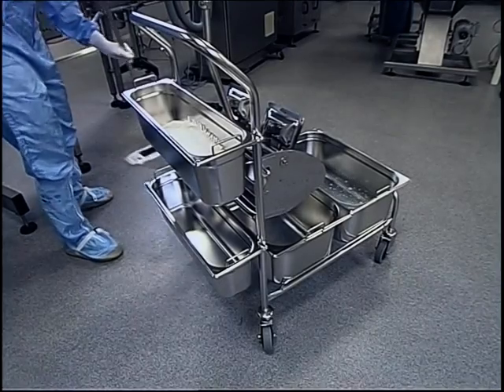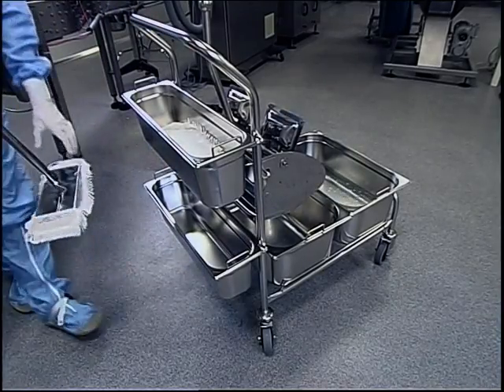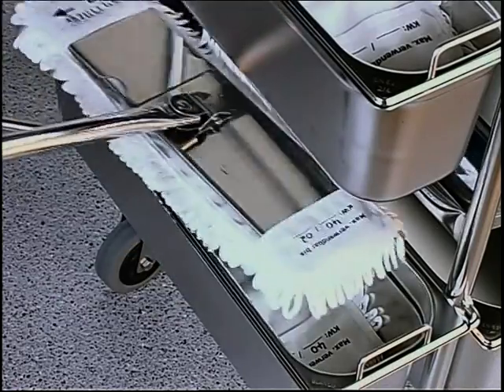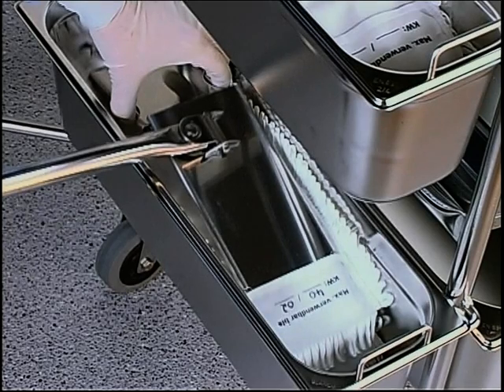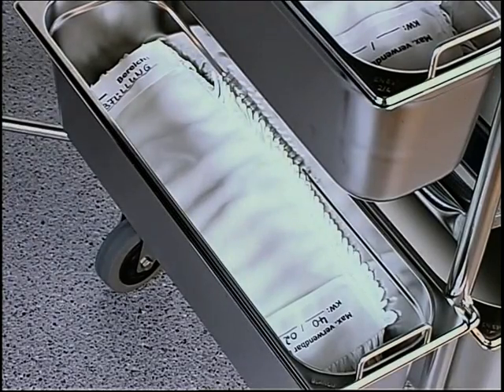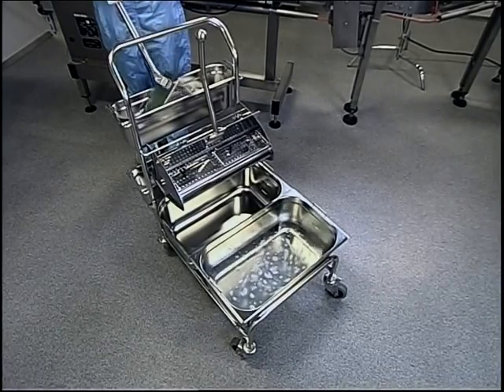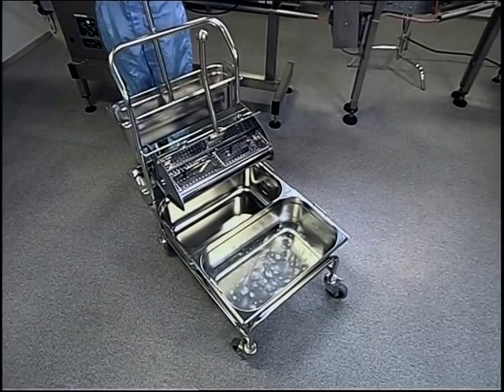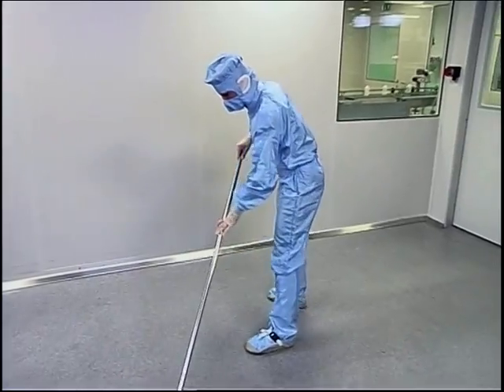Can you simply immerse the mop in the liquid again? Most certainly not. That would ruin the whole disinfection solution. So, place the used mop in the lower container and release it from the holder without touching it with your hands. This prevents the transmission of microorganisms from the mop to your hands. Pick up the new mop from the upper container using the mop mechanism, and the next wiping session can begin.